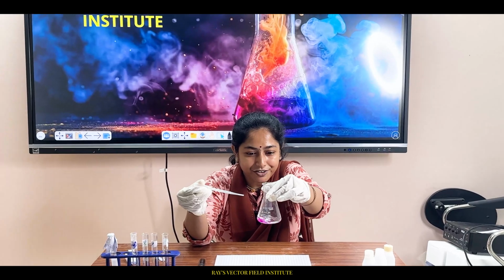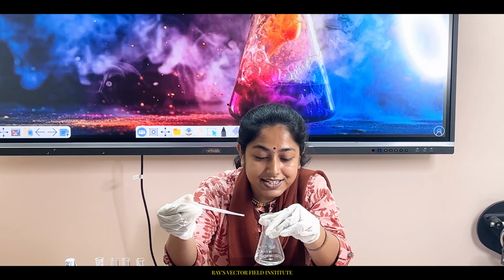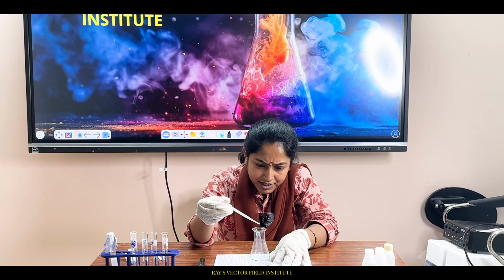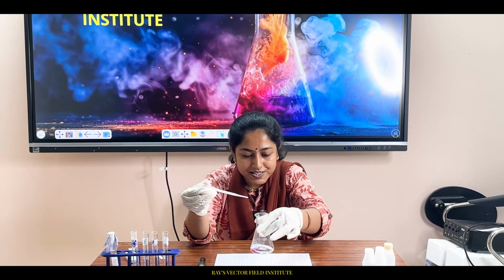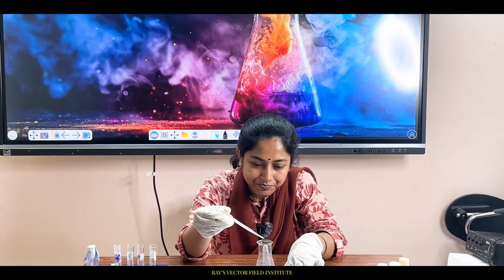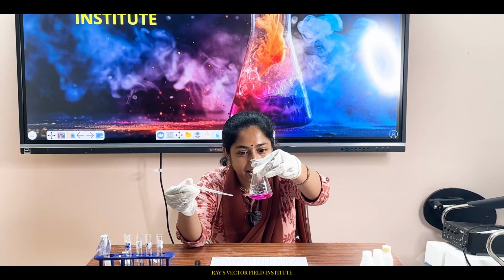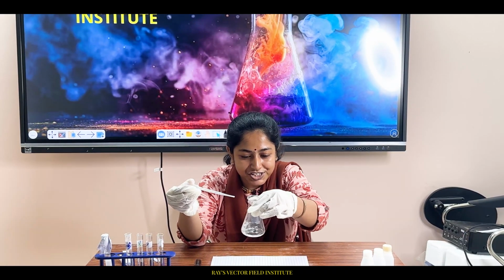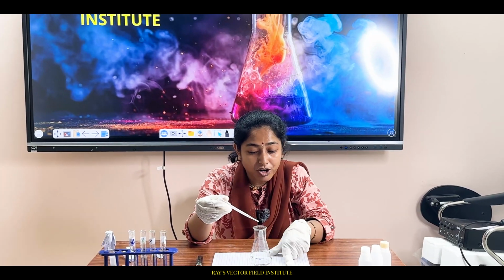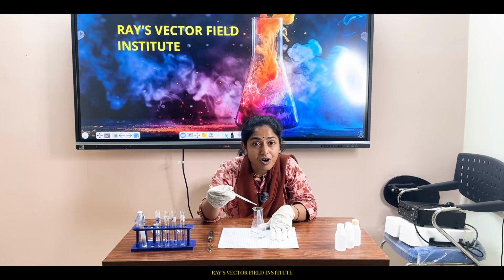See, at this point of adding, pink color has begun, has come up, but again vanished. Let's add one more drop. See, color came and vanished. See, again color came and vanished. You need to explain to me why this color is coming and due to what reason.